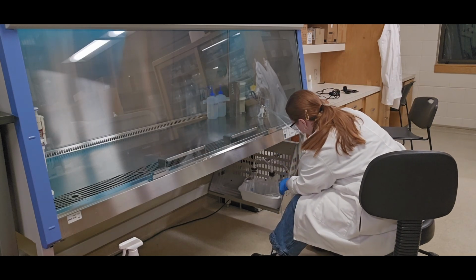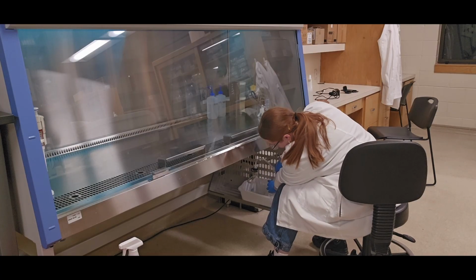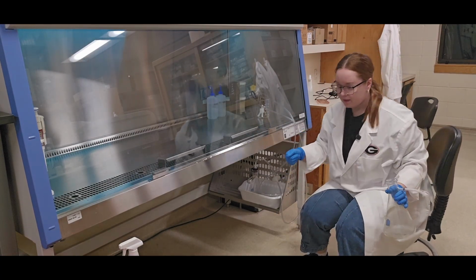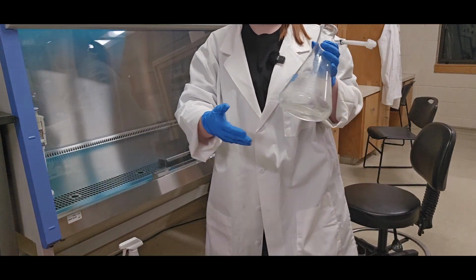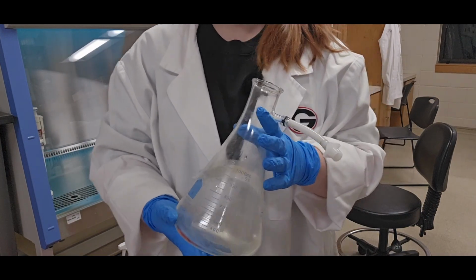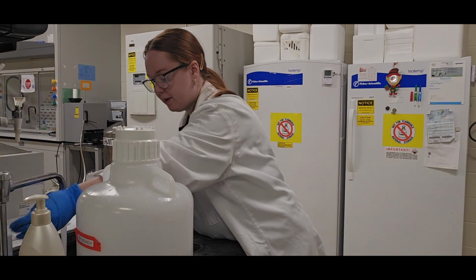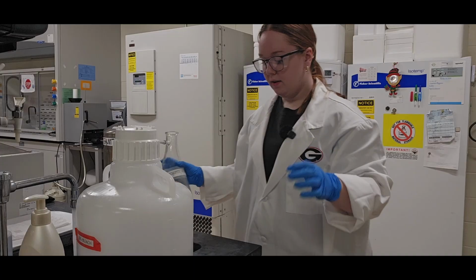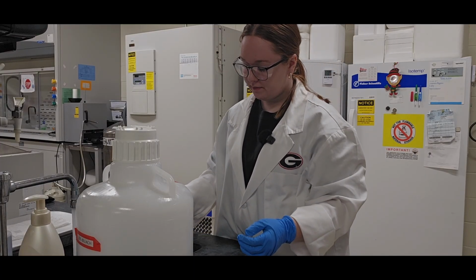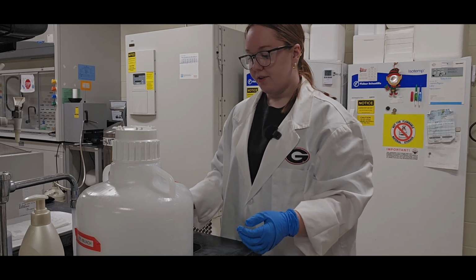And now I'm going to empty out the traps. Sometimes both need to be emptied out down here. We have 2 in the Chameleon Lab, but just this one seems to need emptying out. Want to turn on the water and do it a specific way. And I am allowing the water to run and help dilute this as it goes down the sink.